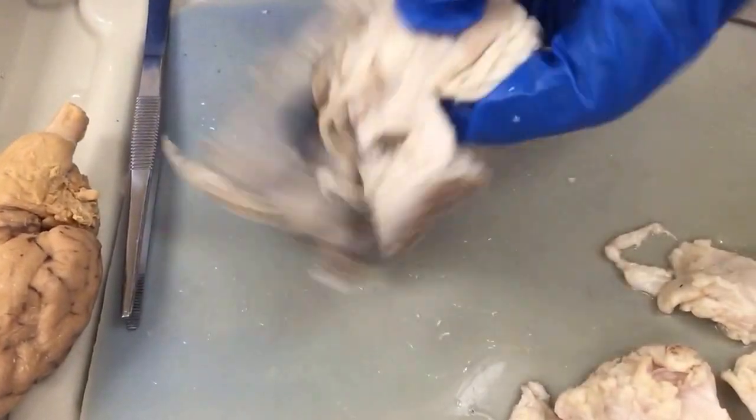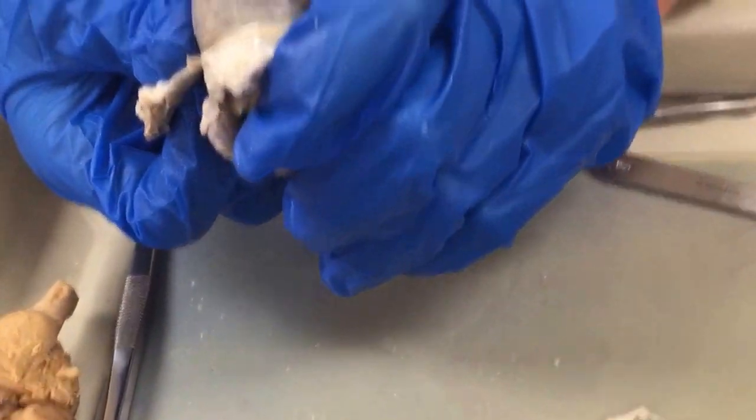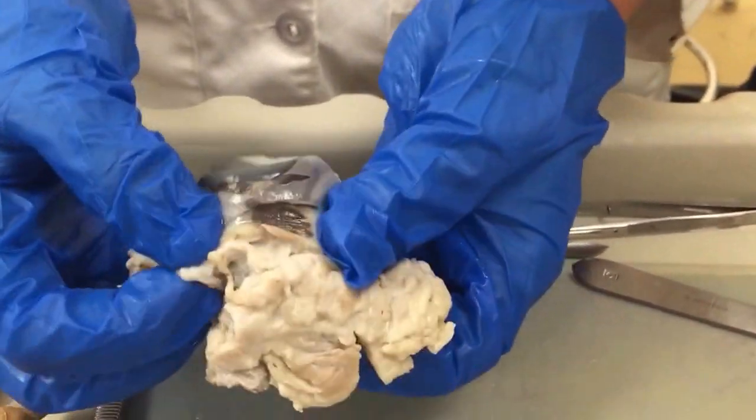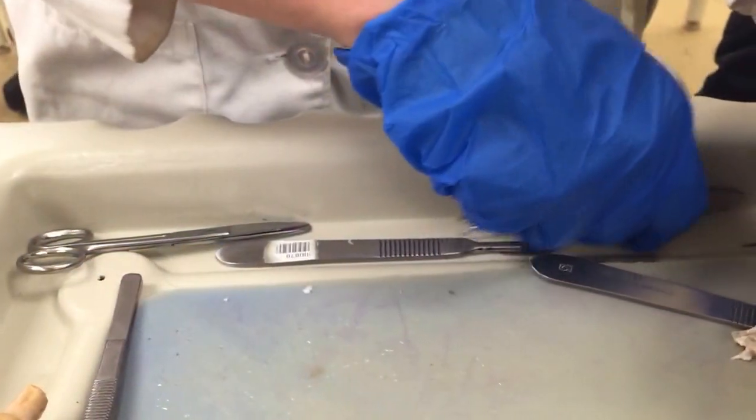All right, if we flip it over, I'm glad you guys find that so amusing.